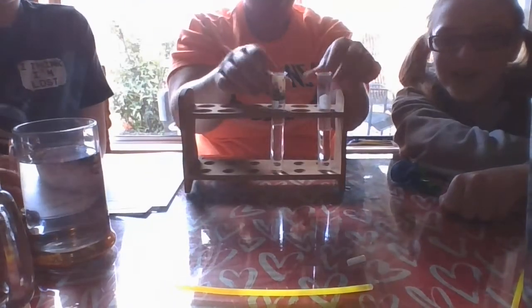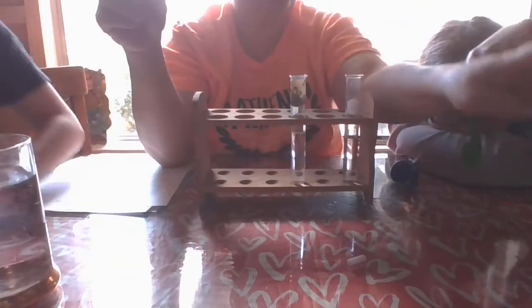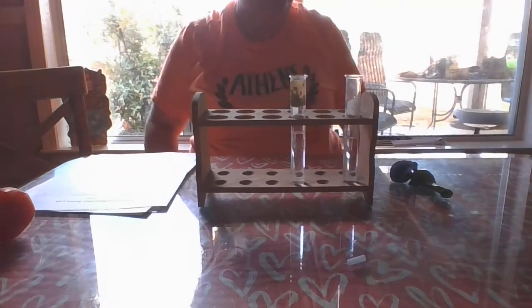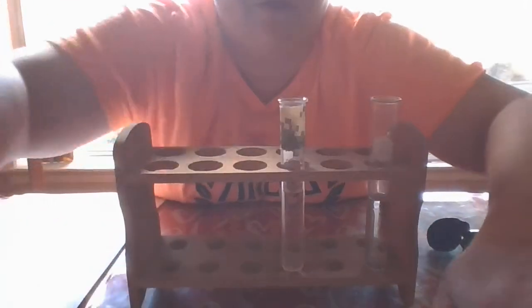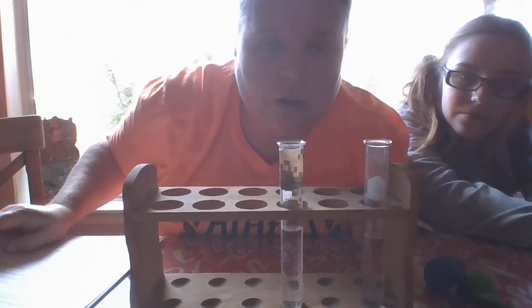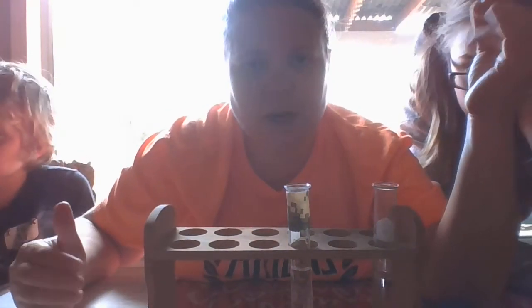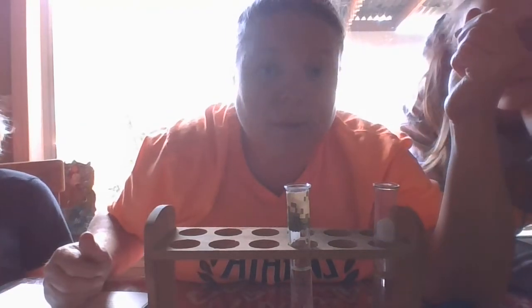We'll set that aside. Now, experiment two is surface area — and Mrs. V forgot to buy chalk. So I'm going to try to find another YouTube video for you guys to finish that one. Just leave room in your notebook to do it. I'll go find a video, or when I go back to school I'll go to the dollar store, buy some chalk, and do another video. Make sure your table's in there with room for answers A and B. We're going to skip right to experiment three.